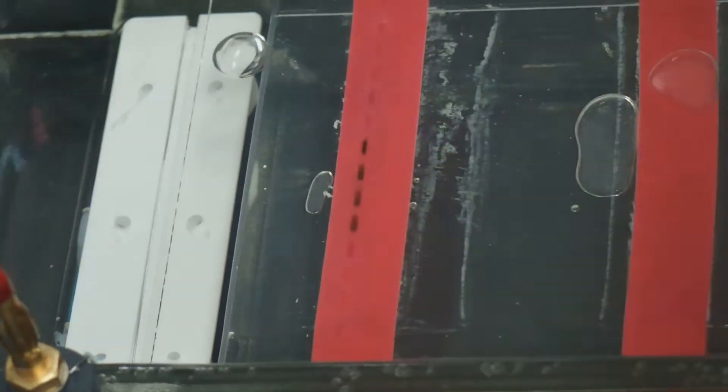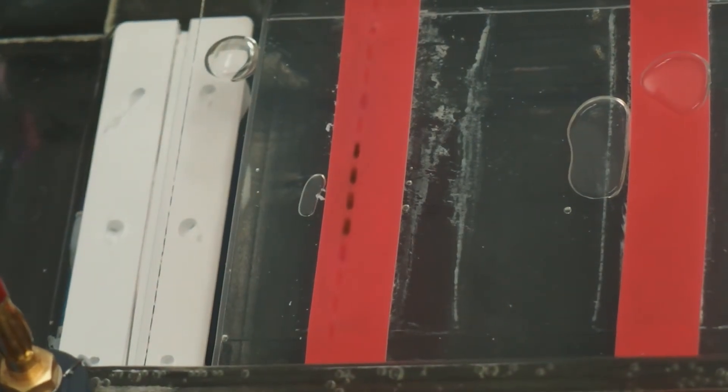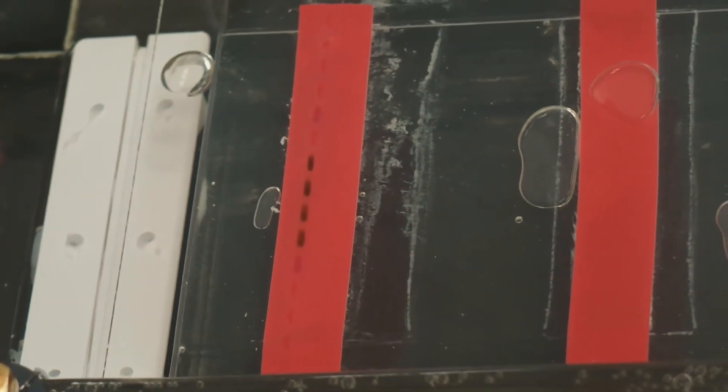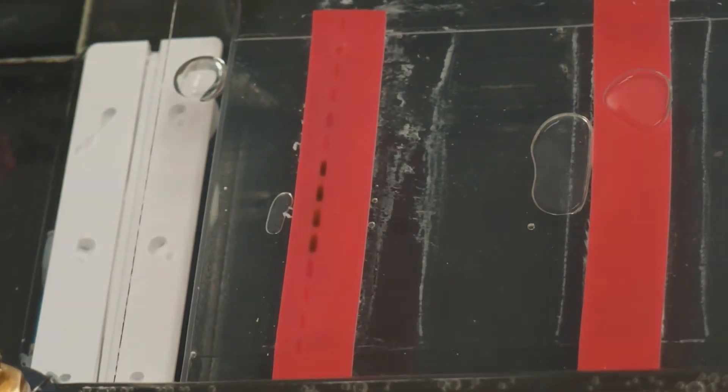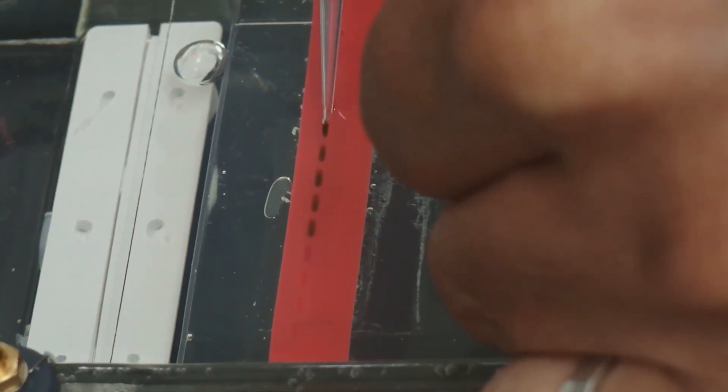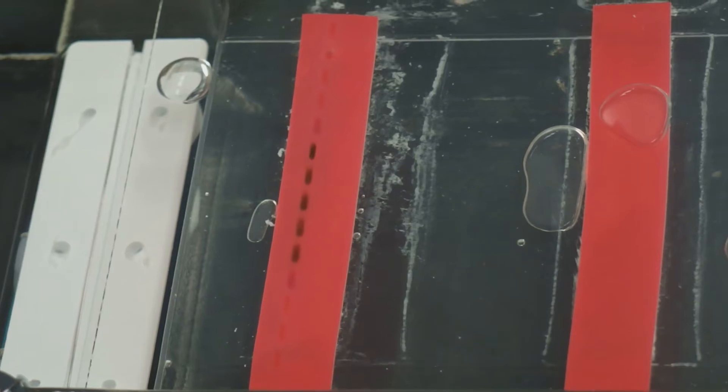It makes it easier to see where you've loaded. Most loading dyes are either blue or green, and they show up pretty well against the red background.